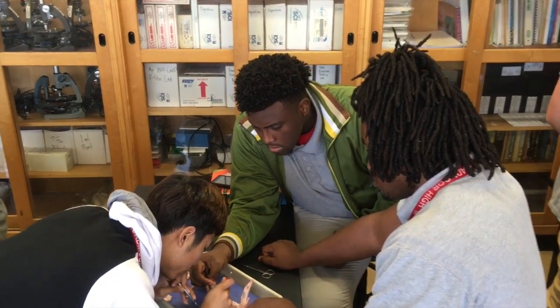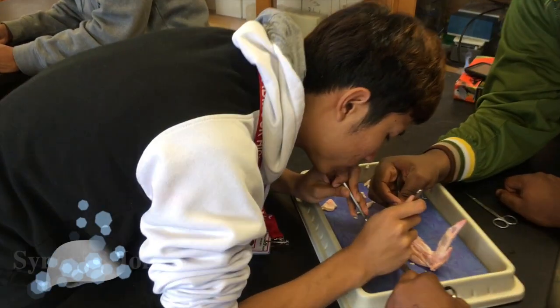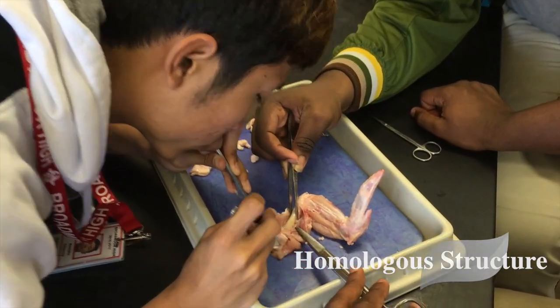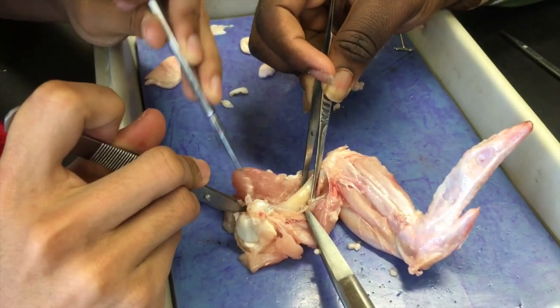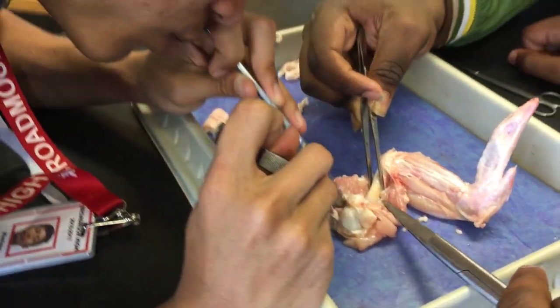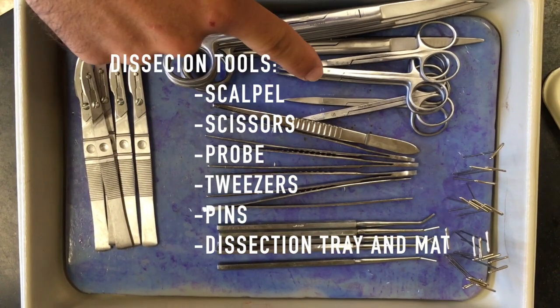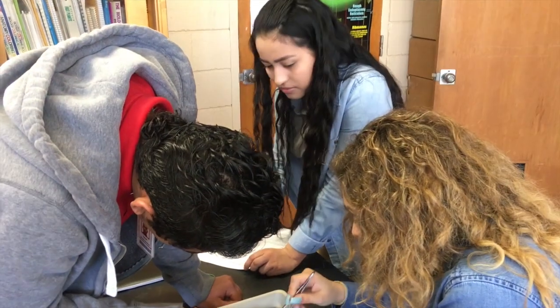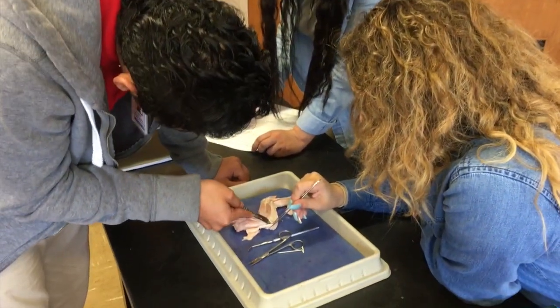Hi, I'm Alex Darden. I'm a teacher at Broadmoor High School. Today we're going to do a chicken wing dissection. The chicken wing dissection achieves two major goals. The first is we get to look at a synovial joint — a homologous structure inside a bird's wing that's really similar to a human arm — so it's a great way to review all the bones, muscles, and the elbow joint inside the human arm. The second goal is we get to look at and practice using our surgical instruments as dissection tools. We get to practice with a scalpel, what it means to safely handle these instruments and use them properly, so that when we get to more complicated later dissections, we already know how to use the tools. So let's jump on in.